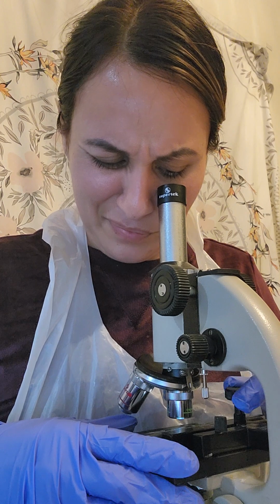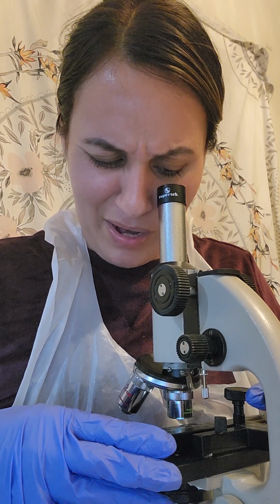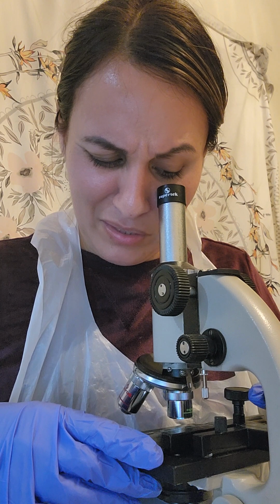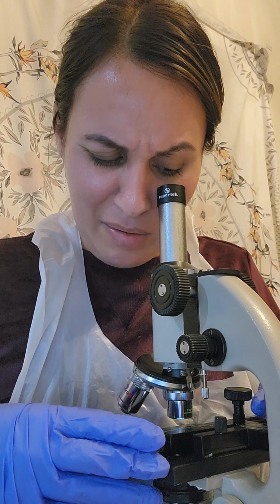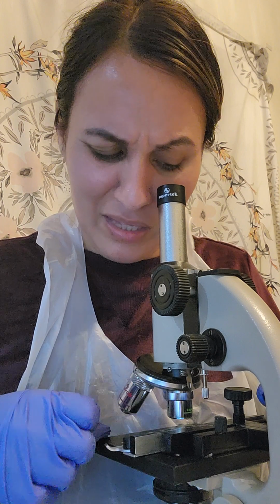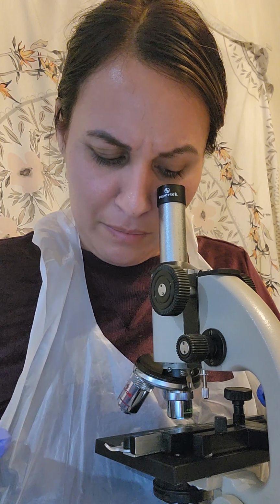Okay. So this is pretty easy. It comes right into focus. And I do have pictures that I already have uploaded. So the Big E, it looks just like it does on the slide. It's a little pixelated on the edges, but it looks like the Big E. So I already uploaded that photo.